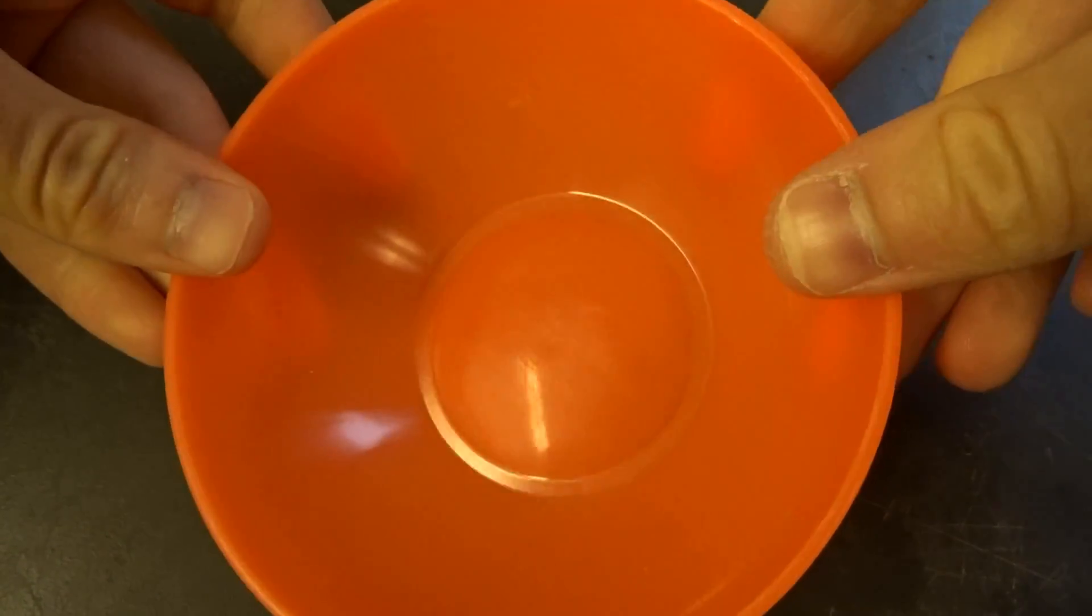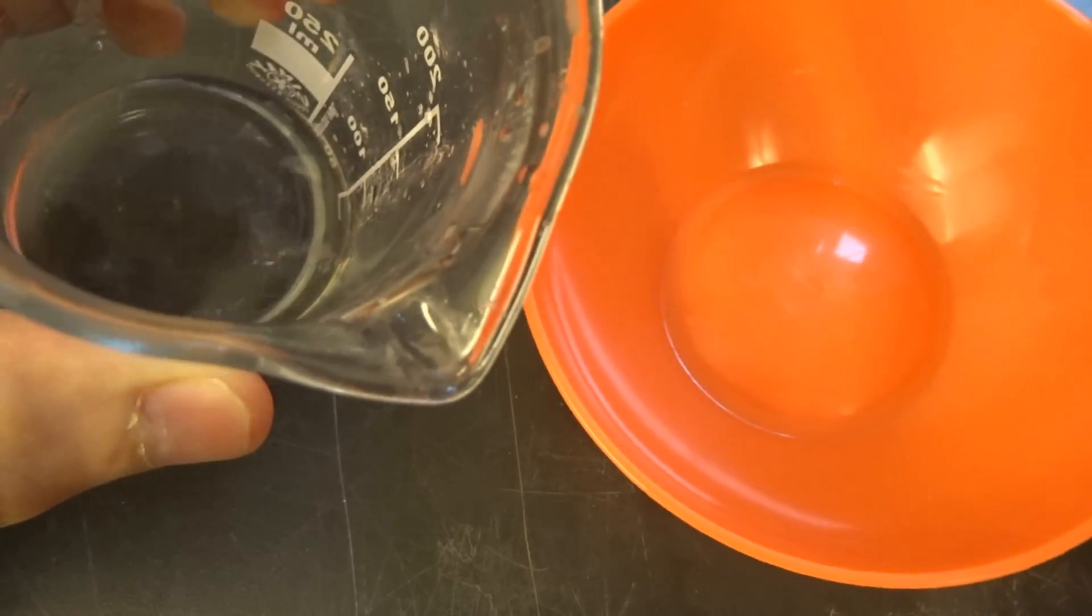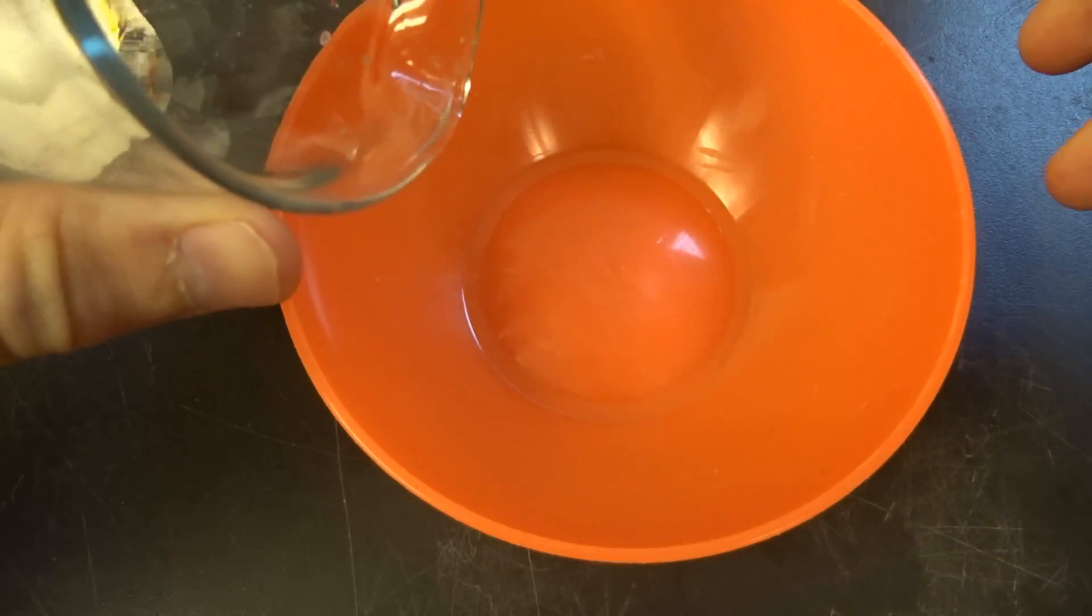And in the process of the aerogels I tried to find out how we can avoid supercritical drying, because I don't like this. So I'll never use glassware for making aerogels, and use plastic bowls like here.